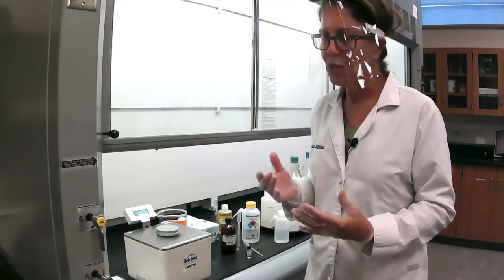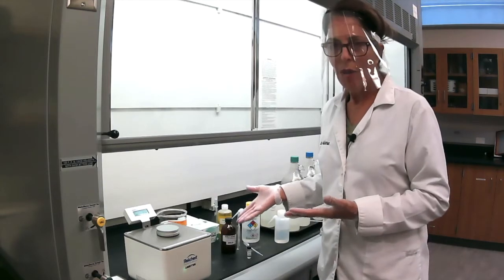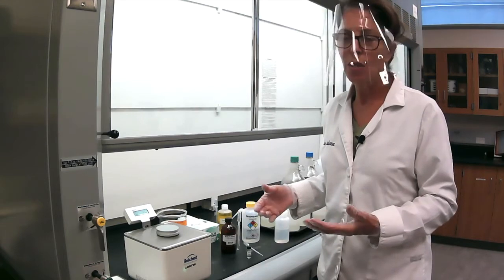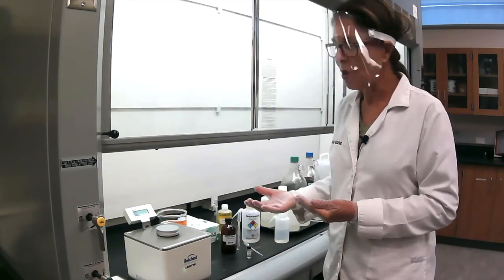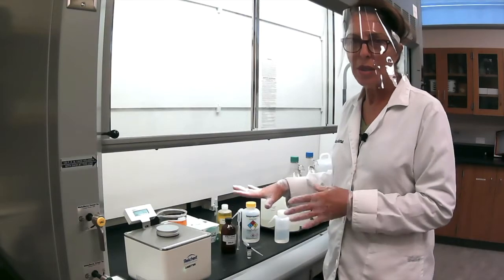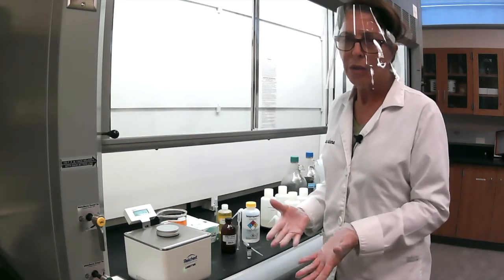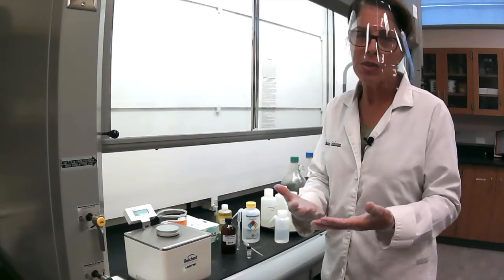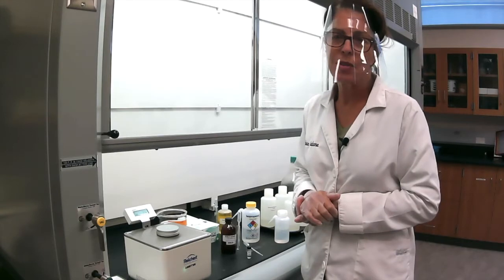Each substance will have a slightly different refraction index, so you can run a few knowns, like we did, for example, for the TLC or the melting point. You measure the melting point for a known and you compare your unknown to the known. We're going to do exactly the same thing here. So we have known liquids that you're going to run and see their refraction index, and then you get an unknown, measure its refraction index too, and correlate and identify your unknown based on the refraction index. Now, how do we use this machine?